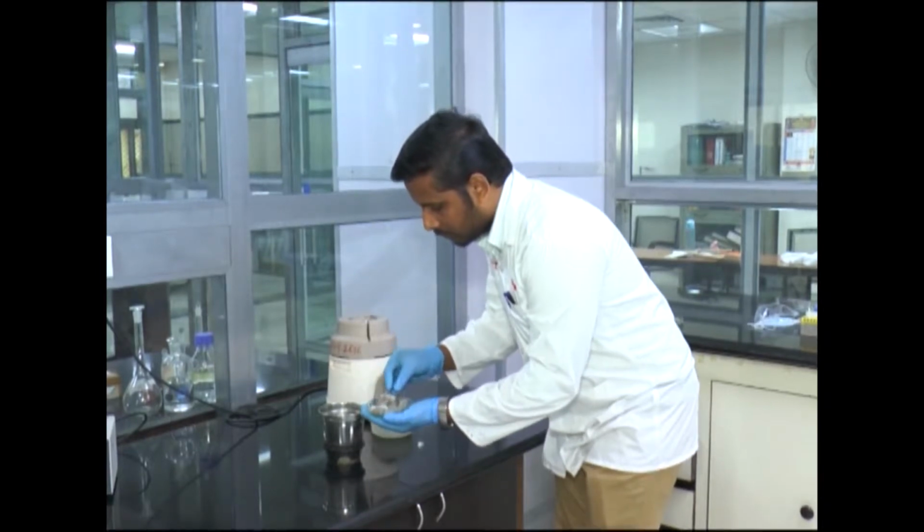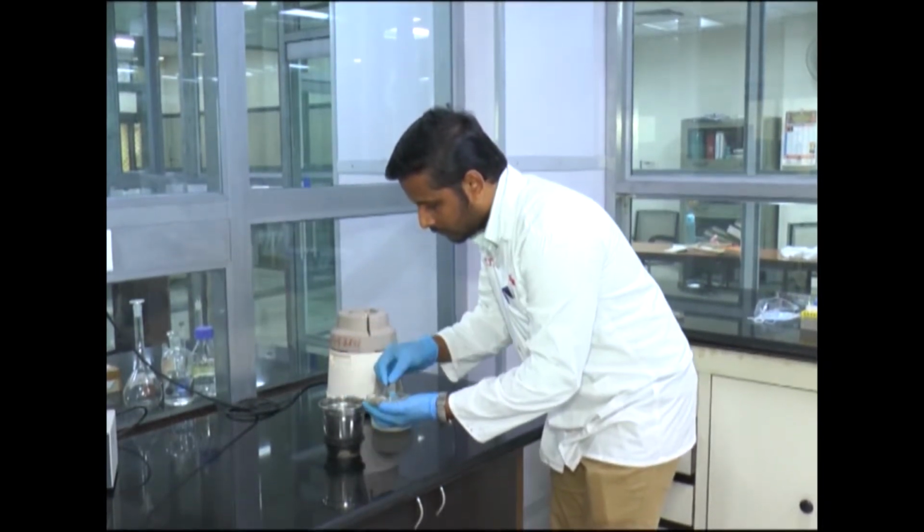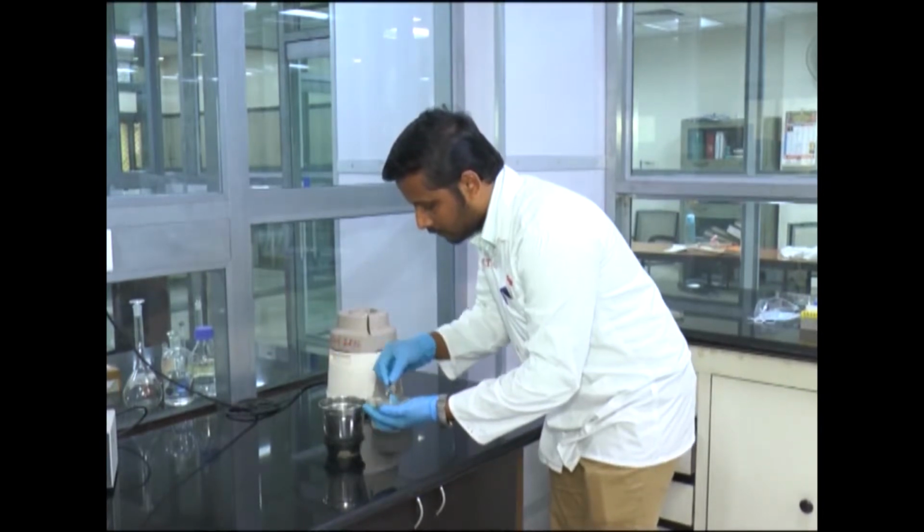The whole sample received is homogenized so that the sample is representative of the whole lot.